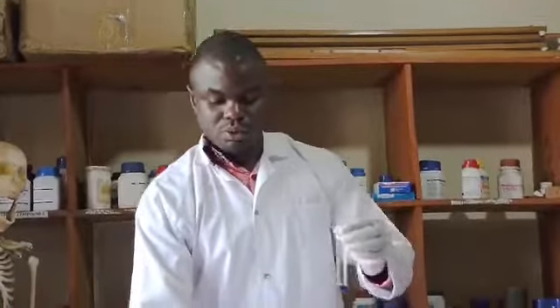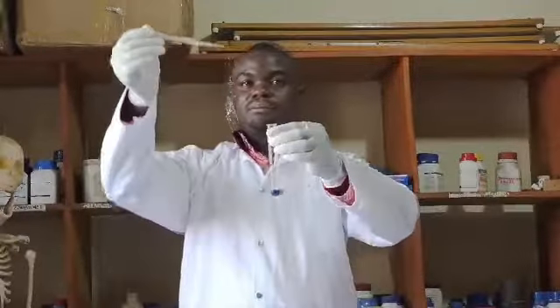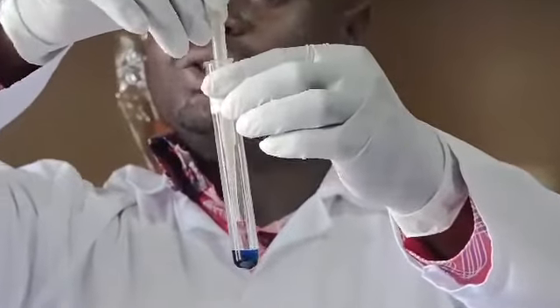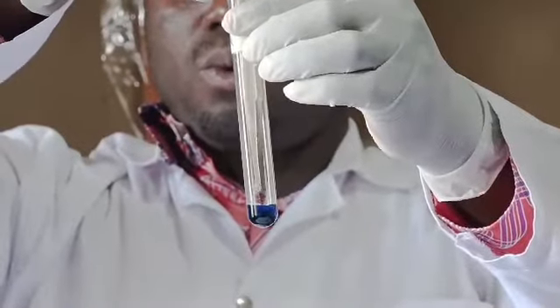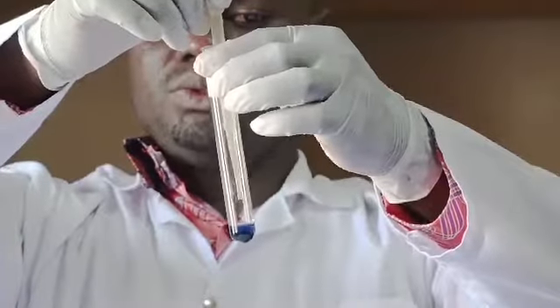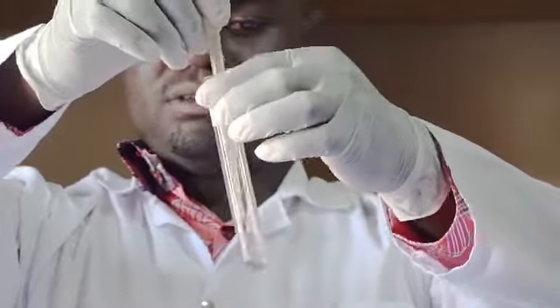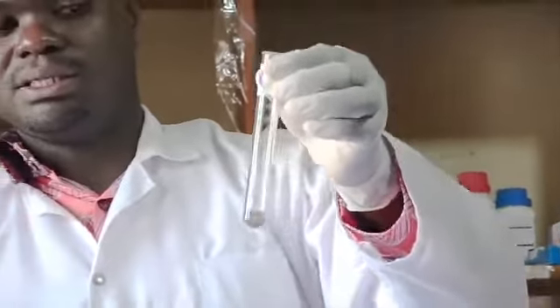So we are adding solution X drop by drop. So I hold my dropper, direct it into the test tube before I release. Therefore, one, two, three, and four. There you go. And that is our final color. You can see it is colorless.